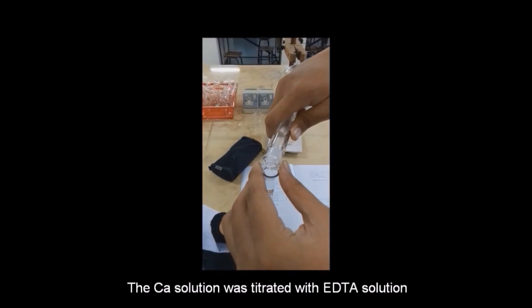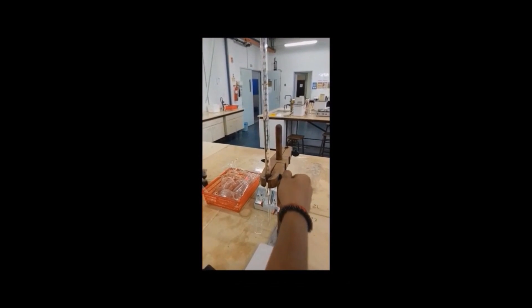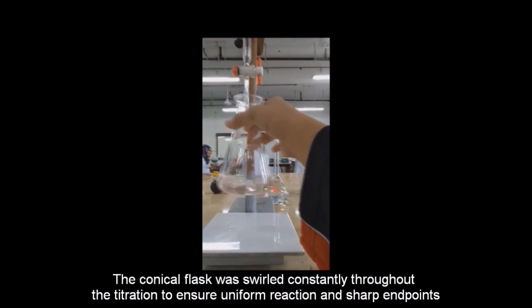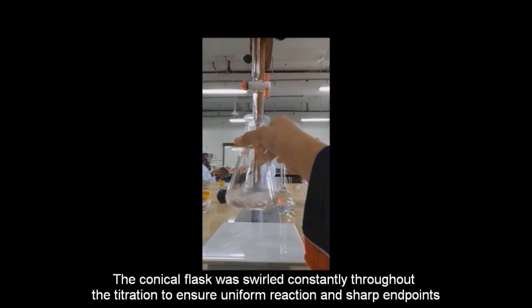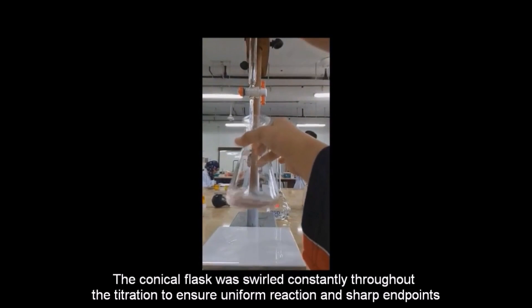The calcium solution was titrated with EDTA solution. The conical flask was swirled constantly throughout the titration to ensure uniform reaction and sharp endpoints.